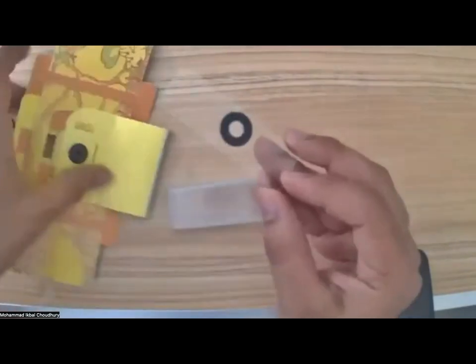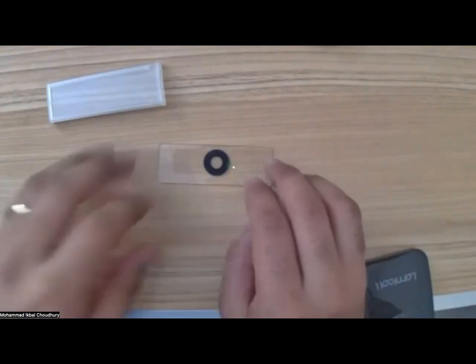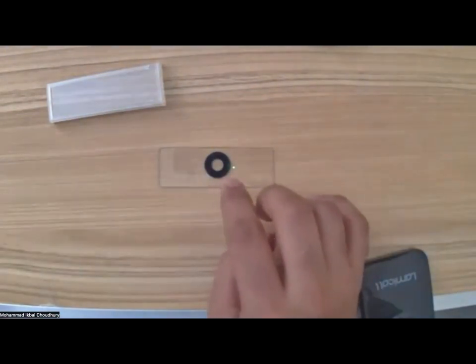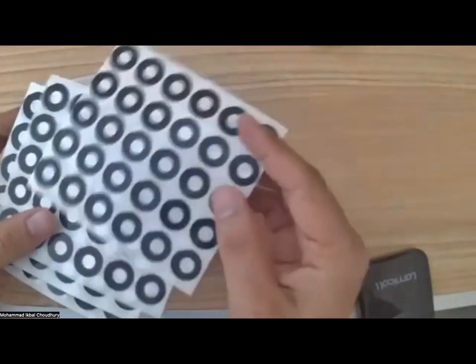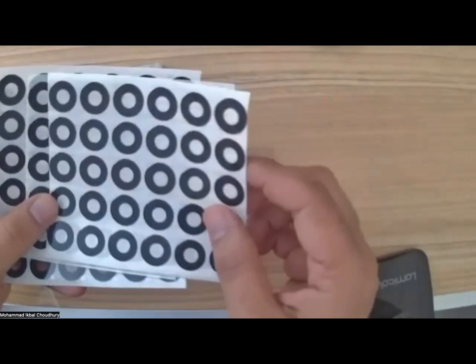These are fairly cheap. Okay, let's take this slide, and you might wonder what is there at the center, like the donut shaped thing here. So in the foldscope kit, you probably have received ring stickers like that. These are ring stickers, not as many as I have, but there are 3 kinds of ring stickers that you probably have received.